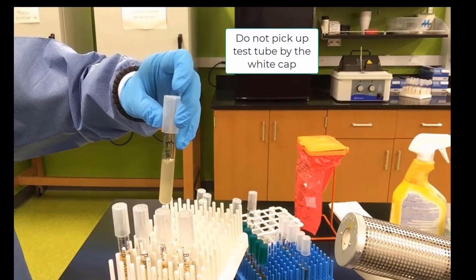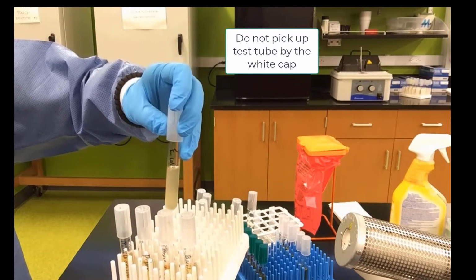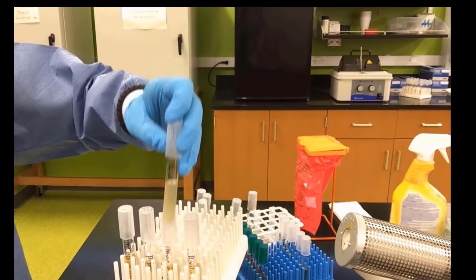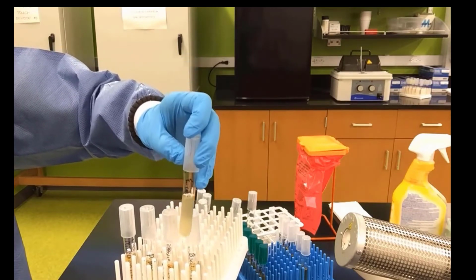Notice not to ever pick up the test tube from the white cap, but support it from the bottom. You don't want it to fall and then you create broken glass and also have a bacterial spill. So be very careful with the white caps.